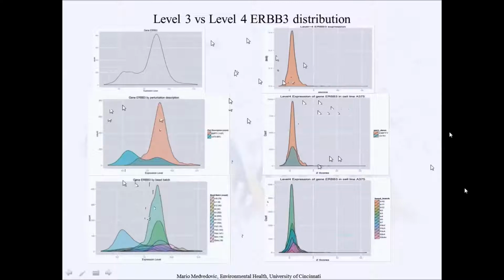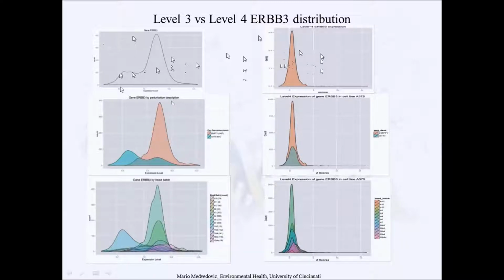And as you can see, on the left-hand side are still the original figures for level 3 data, and on the right-hand side are the equivalent figures for level 4 data. As you can see, this bump disappears in level 4 data, so it's normalized out somehow. So the z-scores of ERBB3 across all these same profiles look the way you would expect them to look, meaning that they all seem to be part, or the vast majority part, of the same bell-shaped distribution.